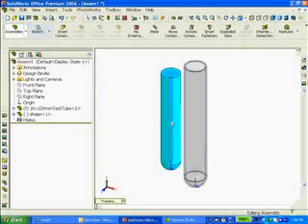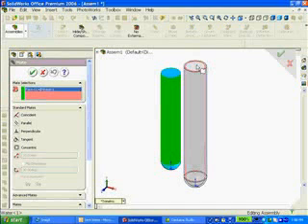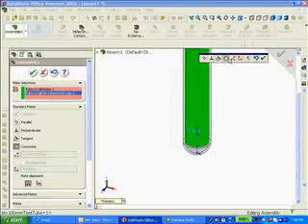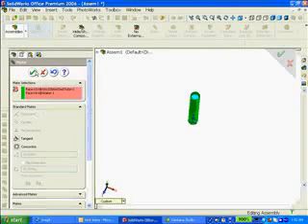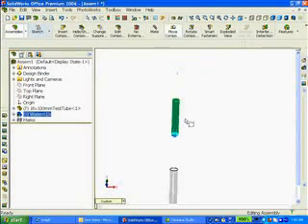I need to create a few mates. First, I'll click on Mate. I'll select the cylindrical face of the water and the cylindrical face of the test tube. Concentric is selected by default, and then I'll click OK. Now, my water is inside my test tube. I'm going to drag the water out.